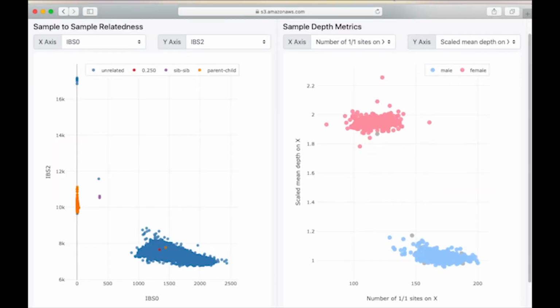Here is a Somalier report for a cohort of 1,000 samples that ran in about 4 seconds. On the right, each point is a sample and the color indicates the sex given in the project manifest. The current axes compare the specified sex of each sample to the sample's X chromosome sequencing profile, with the X giving the number of homozygous alternate alleles, and the Y is the scaled mean coverage. As expected, female-labeled samples cluster with a normalized depth of 2, and male-labeled samples cluster at 1. Male-labeled samples also have more homozygous alternate alleles on the X.